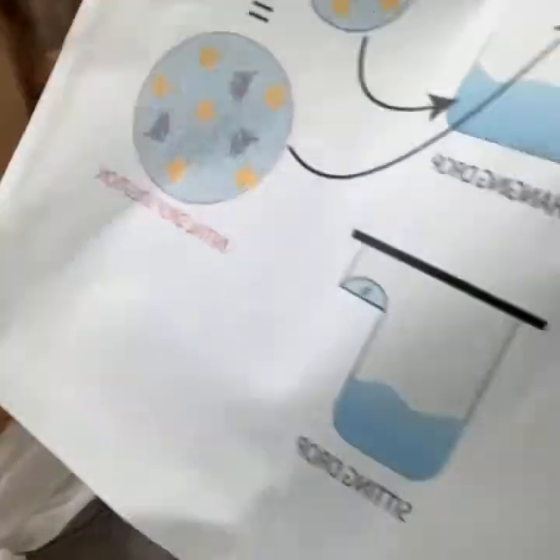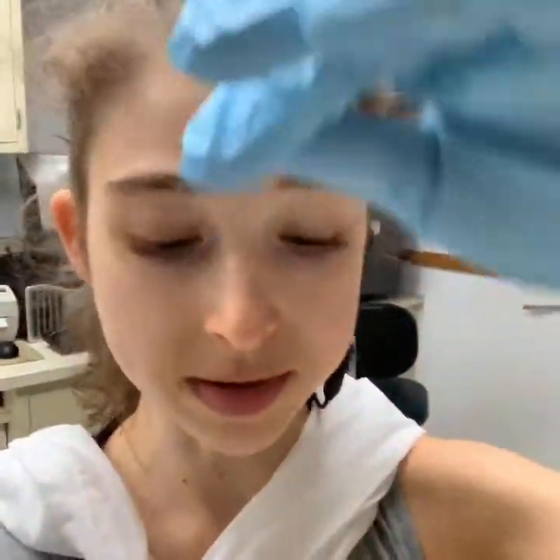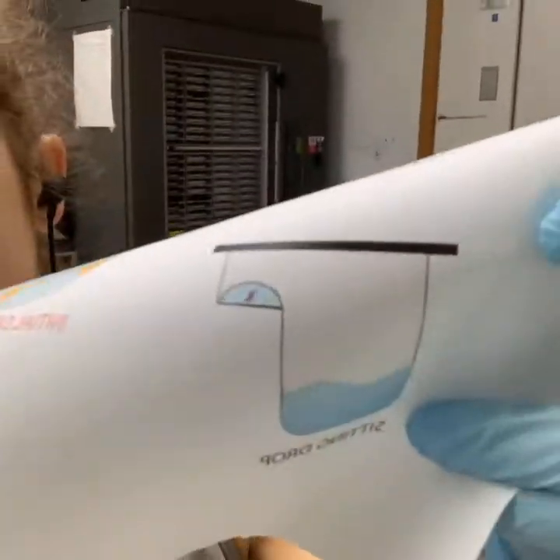You can also do this with the sitting drop method. This is a 96-well format sitting drop plate — there are little indentations at the top where you have a reservoir with liquid and then ledge indentations where you place your protein drop. It's the same principle as vapor diffusion. There are also other methods of crystallization such as dialysis and micro batch.